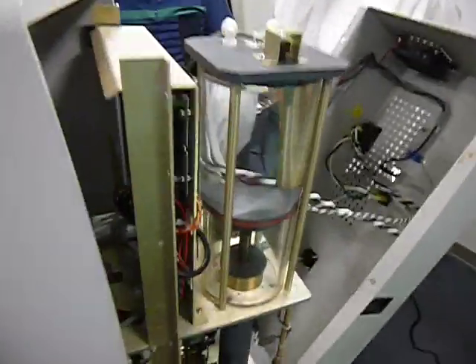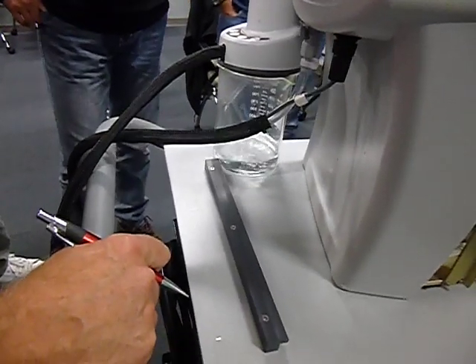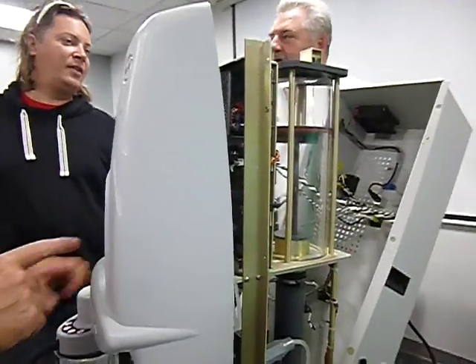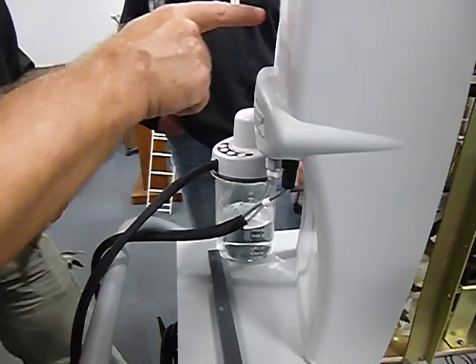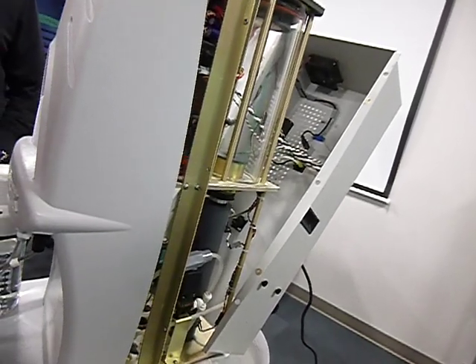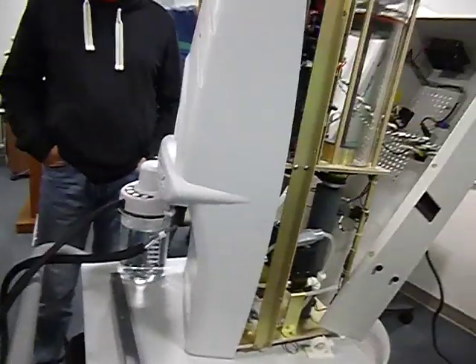It's easy until it breaks. Sometimes I want to shoot myself. We had one of the first ones, and there was one without any temperature inside, so the temperature rose a little bit, so it created overpressure. Now I think if you also hit run a second time, it will make the second shot. So you only place it on the next vessel. You save time this way. This is for washing the system, and here you can use some kind of media, not water, to dispense SLS and different foaming media. Yes, we'll all go over that.